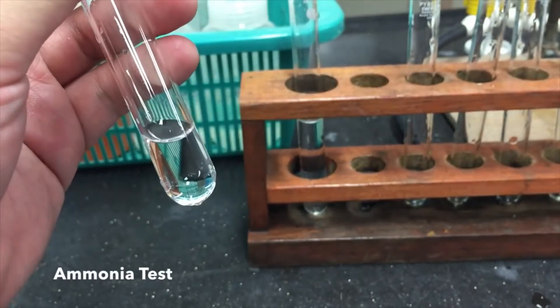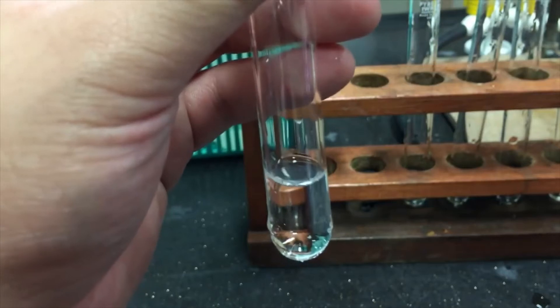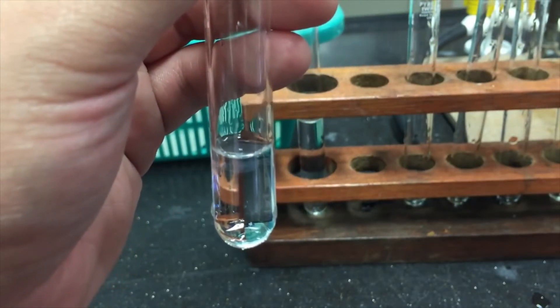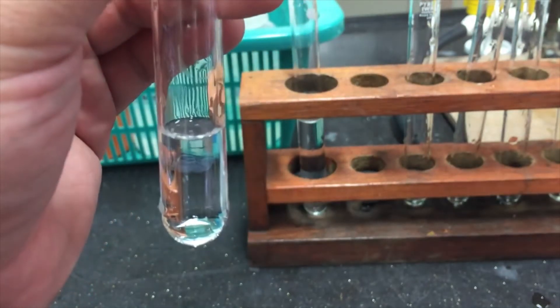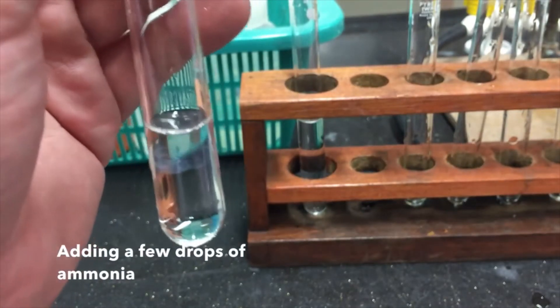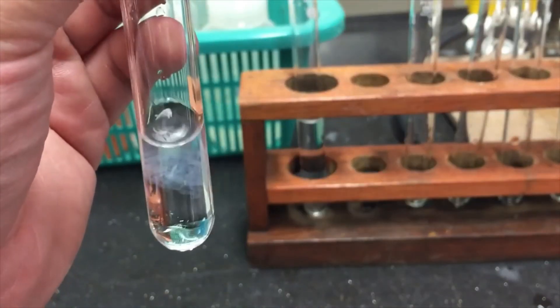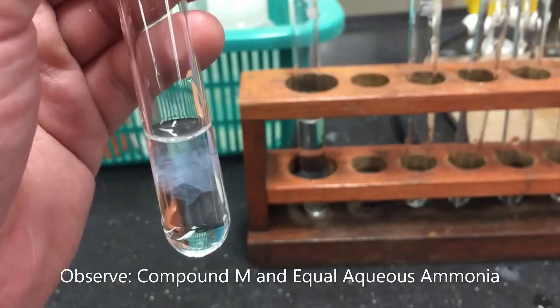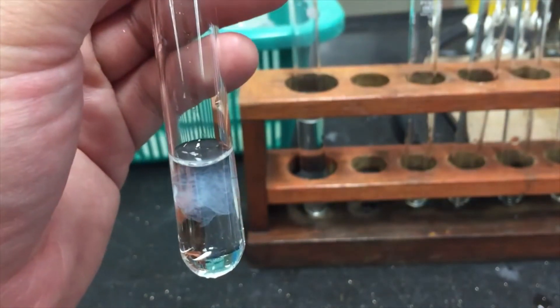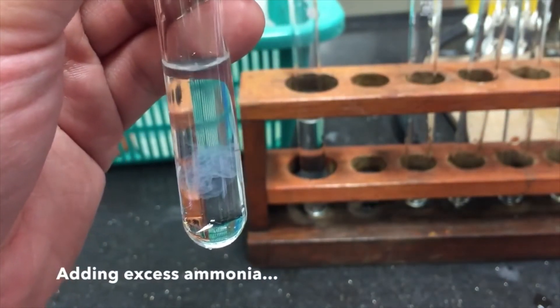We may also use the ammonia test. To a small sample of the solution, add a few drops of ammonia solution. Proceed to add an excess of ammonia solution.